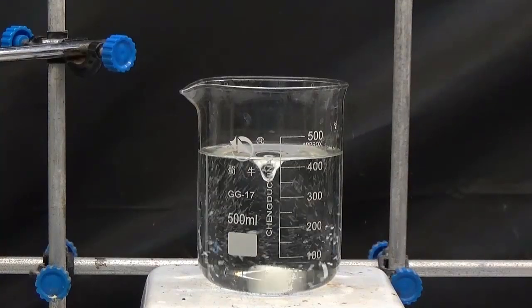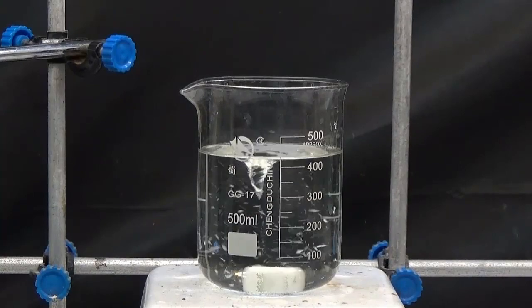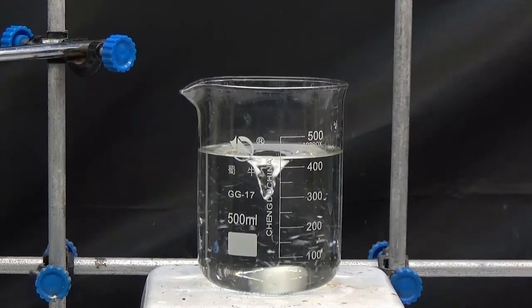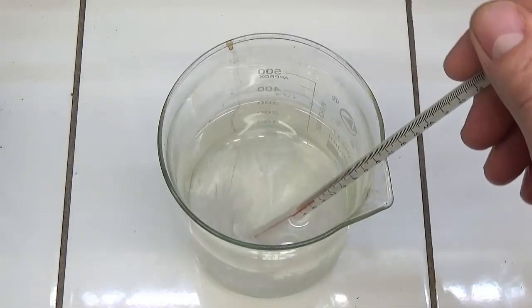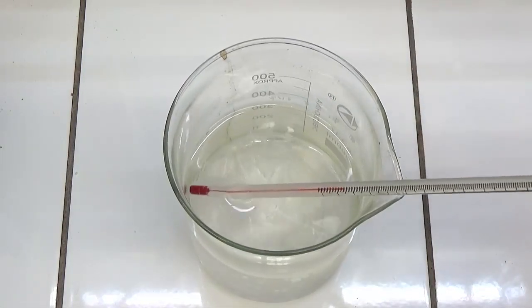Dissolve the solid into 400ml of hot ethanol. Allow to cool and store in the refrigerator for one day. The product crystallized in white needles.